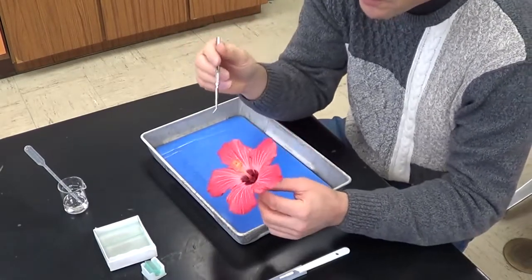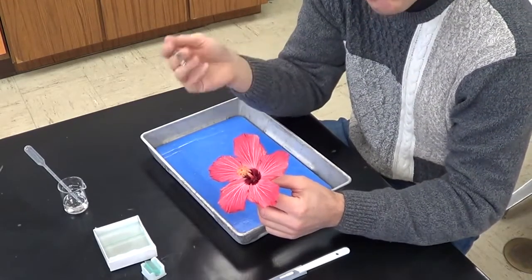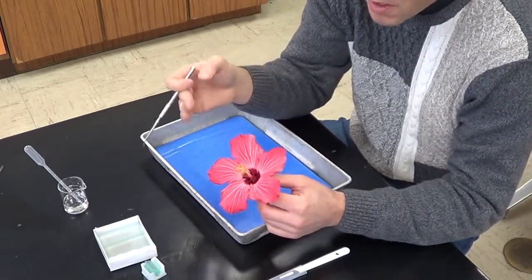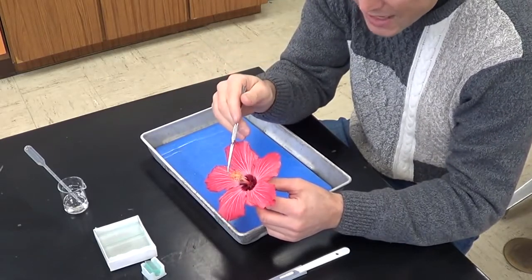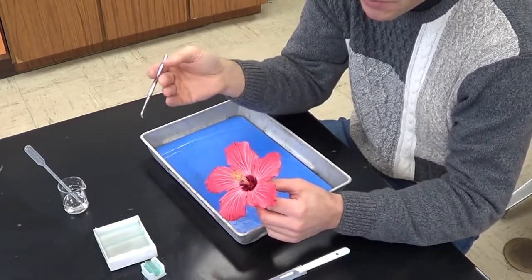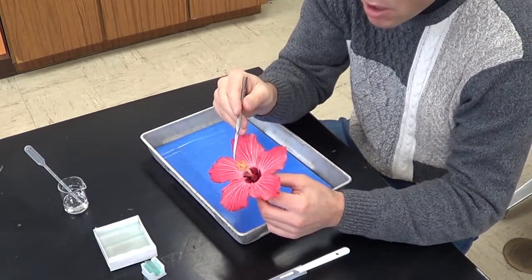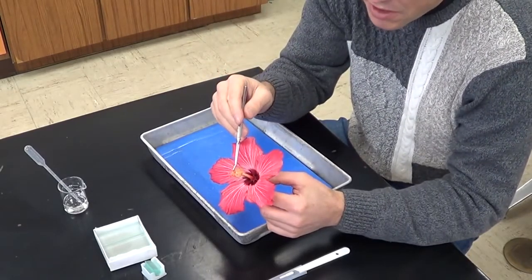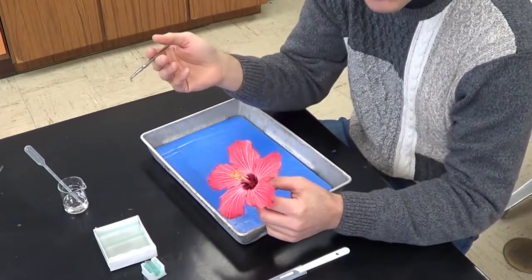And you want to hold that up high so that the wind can blow it or an insect has easy access to it. The next structure, the innermost structure, is the female part of the plant, called the carpel or pistil. It goes by both names. And it consists of 3 parts. The top part is the stigma. I like to call it the sticky stigma because it tends to attract pollen grains on its surface.